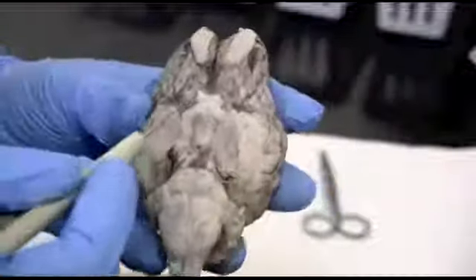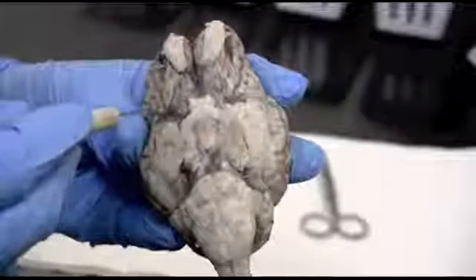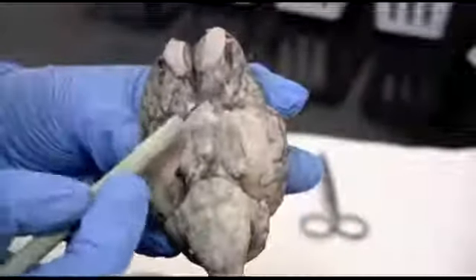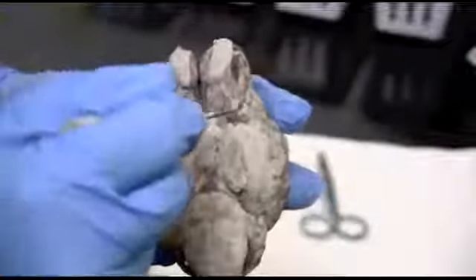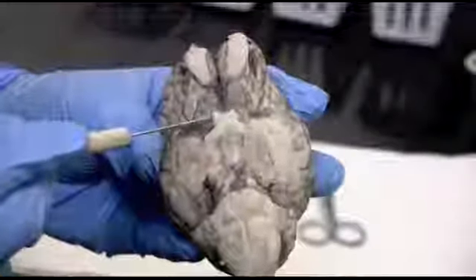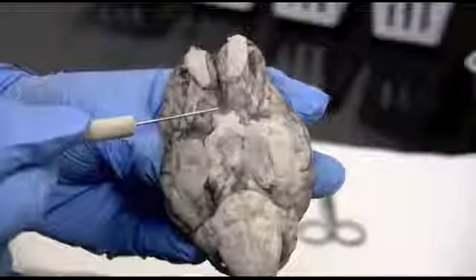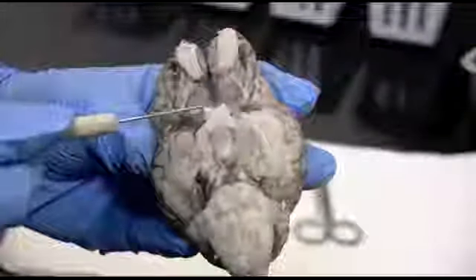Okay. And then we have the remains of the optic nerves. They've been cut away. These are where the optic nerves would have been coming out. So an optic nerve coming out this way and this way, going to the eyes. But now we just have this very last cut of where the optic nerves are. So this X right here is going to be the optic chiasm.